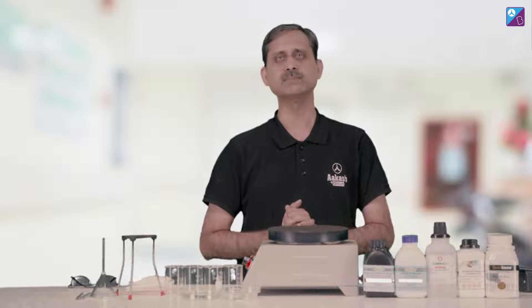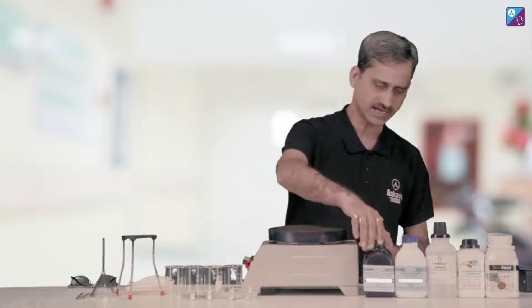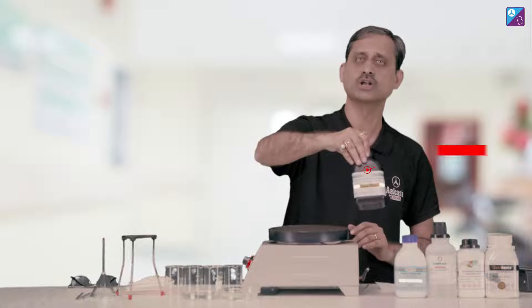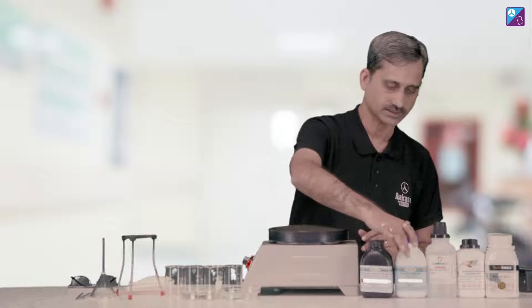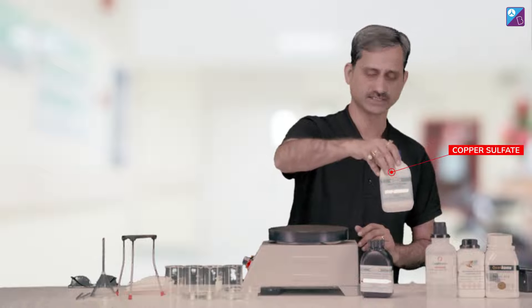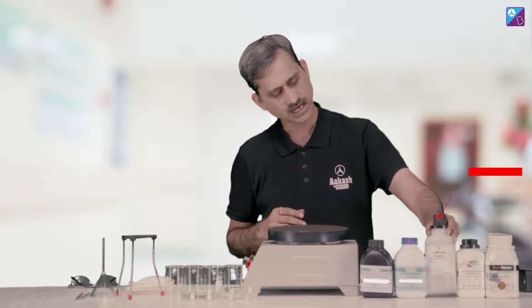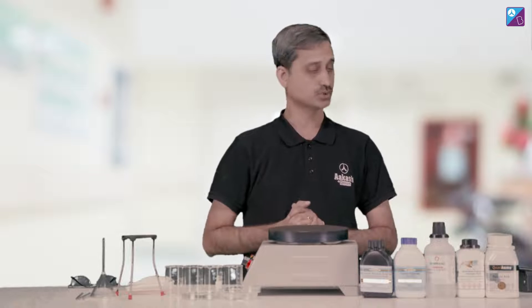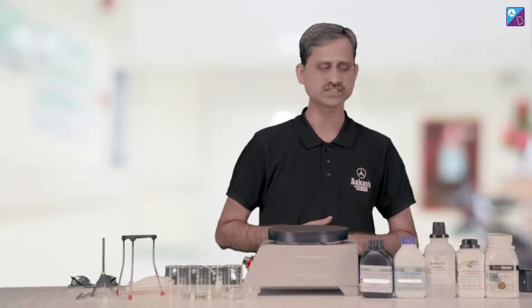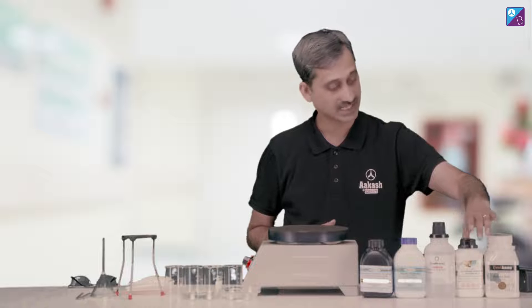Before we start, I will introduce you to the chemicals we are going to use. We have a chemical called Ferrous Ammonium Sulphate — the Mohr salt. Then we have a substance called Copper Sulphate, also known as cupric sulphate. We also have sulfuric acid. And the solution we are creating crystallization for is aluminum potassium sulfate, which we call potassium alum.